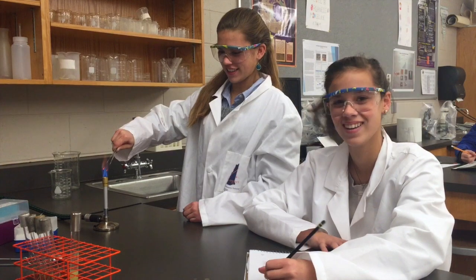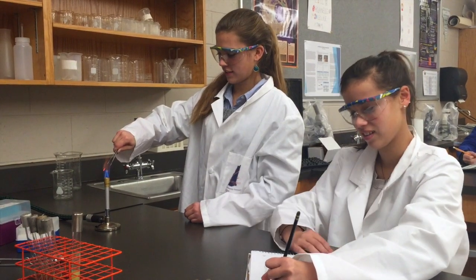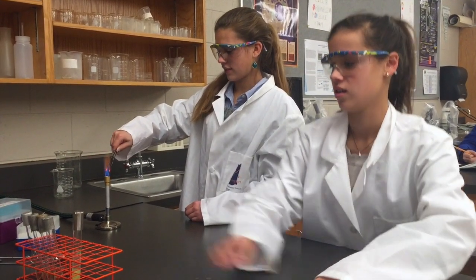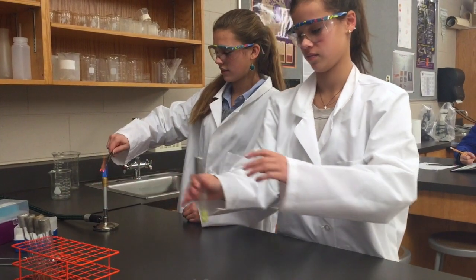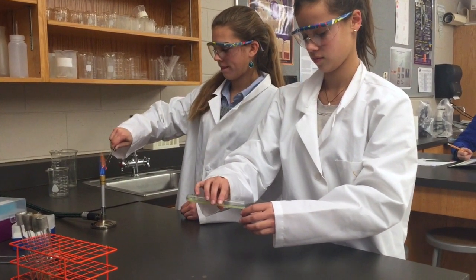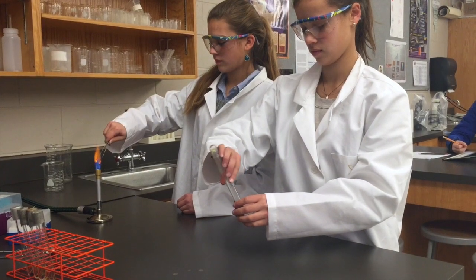While one student is sterilizing the forceps, another student can gently pour the contents of the evolution tube into the cap. Make sure that whenever you are removing a cap from a test tube, you touch just the upper portion of the cap to be as sterile as possible.